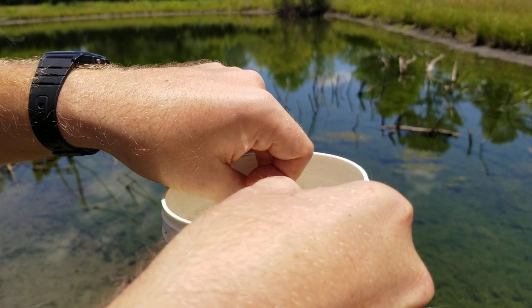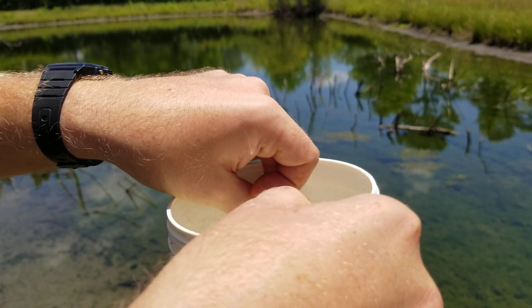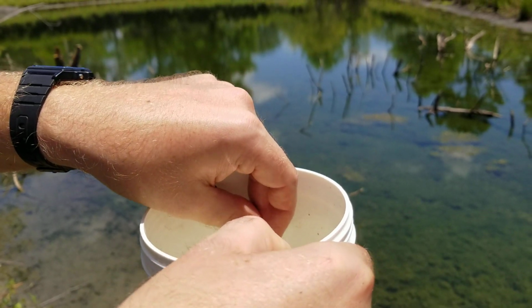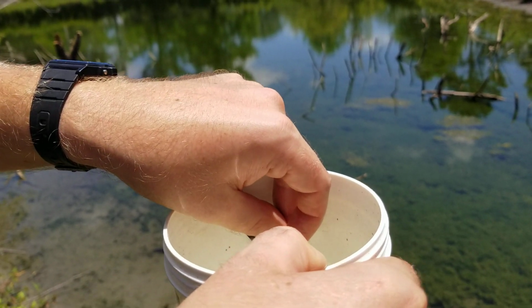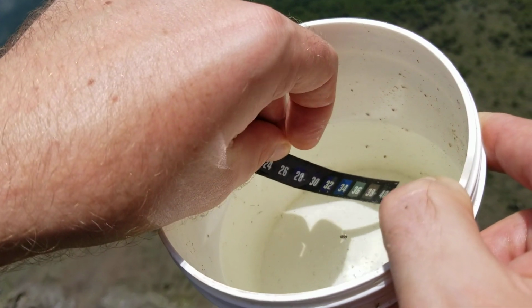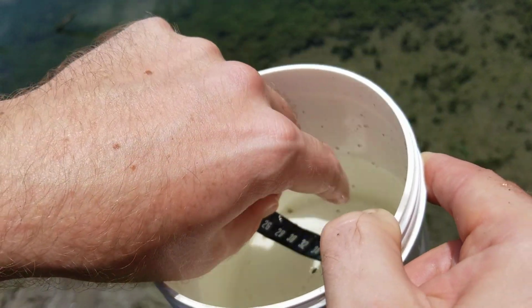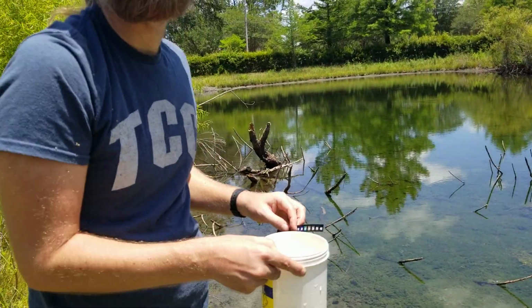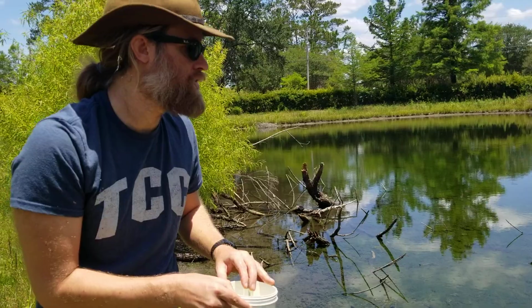We're going to call it 34 degrees Celsius. I think that's fully highlighted right there. It's kind of hard to read these things. They're not quite exact, but that's a good enough estimate for us. This water is pretty warm in general. If you think room temperature is about 25 degrees Celsius, it's a bit over room temperature right now.